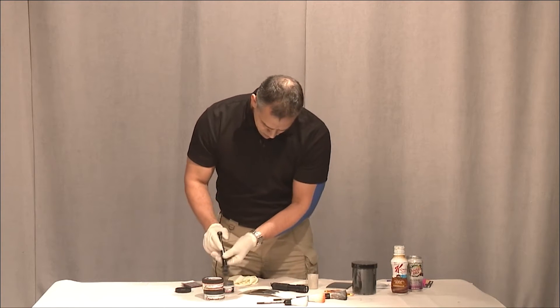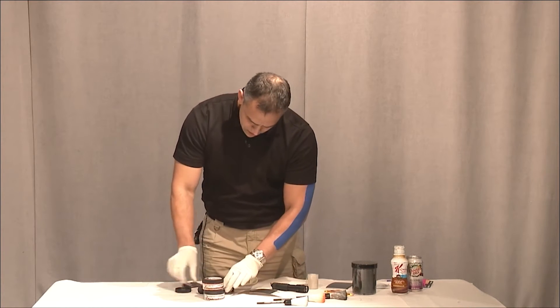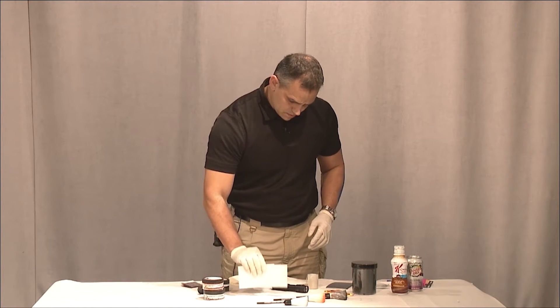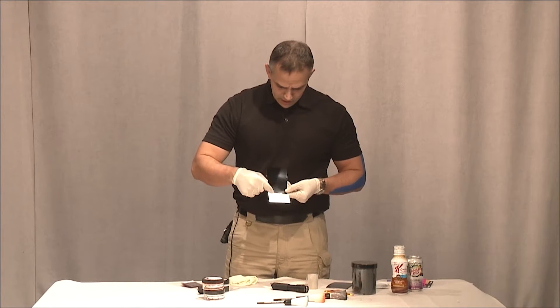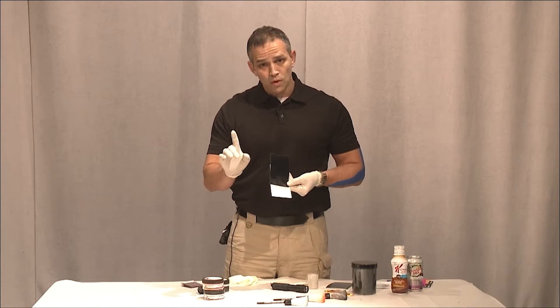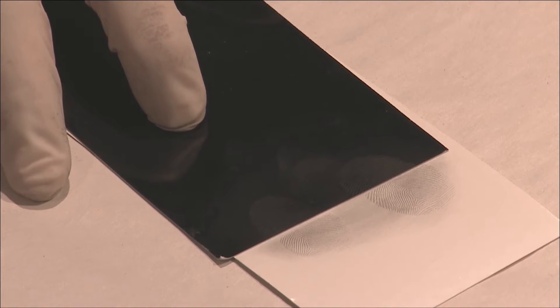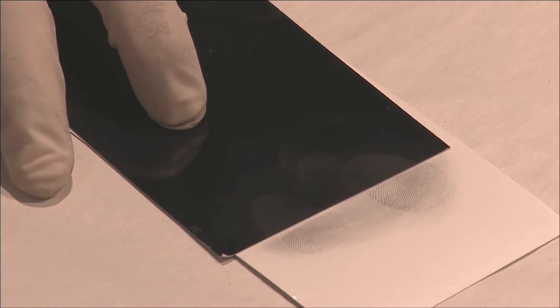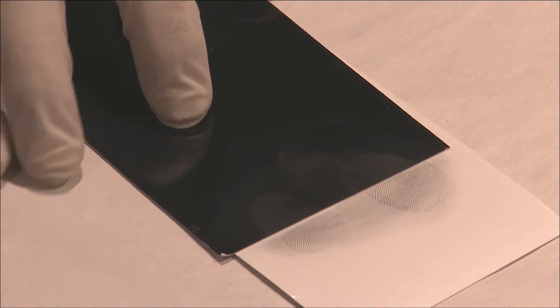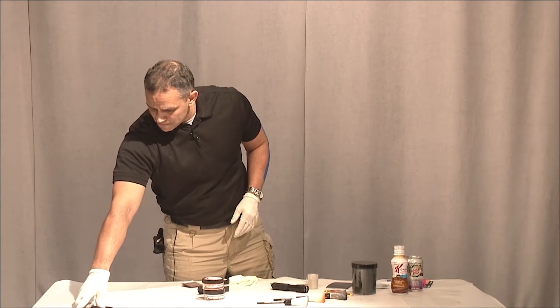Oh, that's gorgeous. Beautiful. Those babies are popping right up. Remember, always put the covers on when we're done. Now you can see I have fingerprints on both the white and the black using one powder. I'm going to put those in for a close-up. You can see both in the photos — you can see it on the black and on the white.